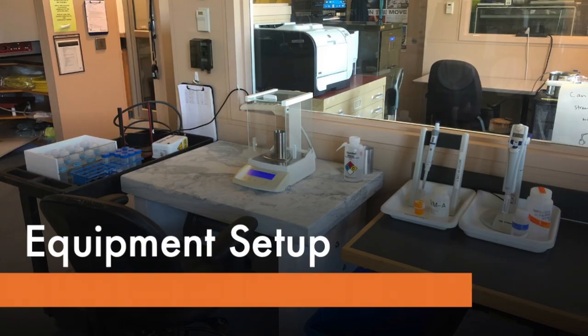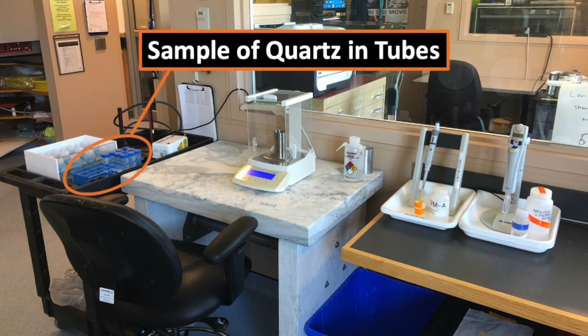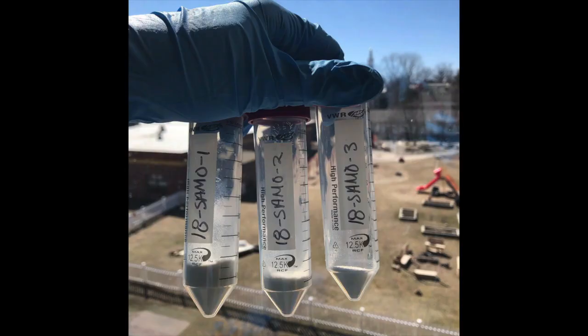So we have a particular equipment setup that we use, and we're going to walk you through those various pieces now. We start with Teflon bottles. Each of those Teflon bottles has a label on it, and each of those labels tells us which sample is going to go in the bottle. We have the samples of quartz in test tubes. These are in 50 ml test tubes. They are labeled, and they have the concentration of various impurities in the quartz on those tubes.